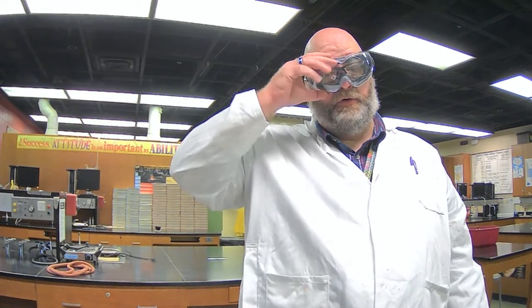All right. The next objects that we're going to measure the mass and volume of are pennies. Now, I've got some old pennies and I've got some newer pennies, new relatively speaking. I haven't collected pennies in a while for my chemistry classes. So I think the 2009 was the newest one I saw in this pile. So that's like 11 years old now.